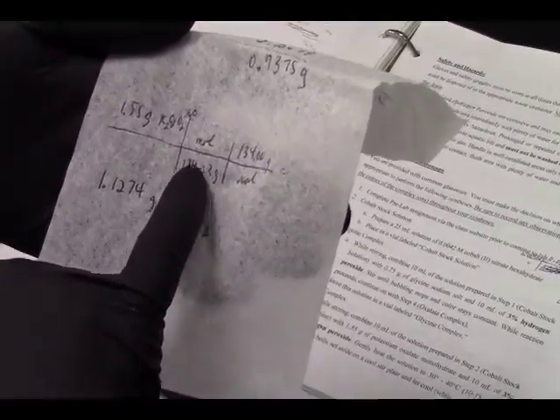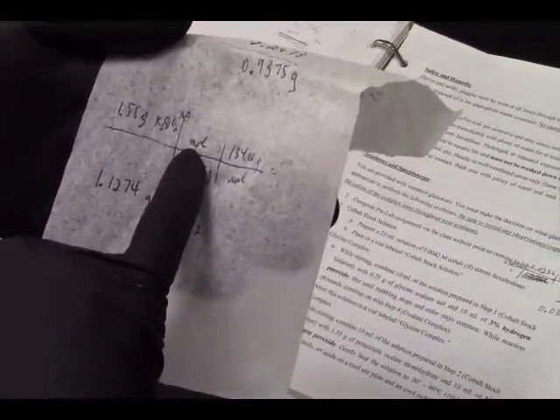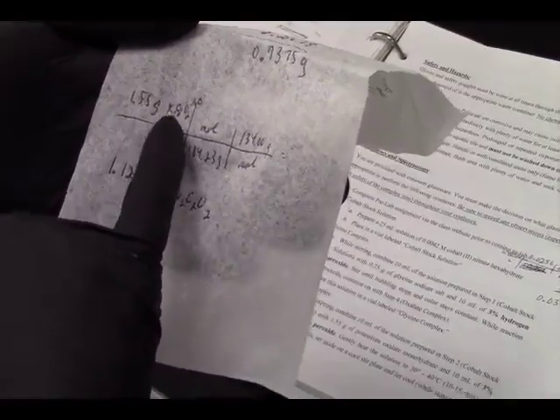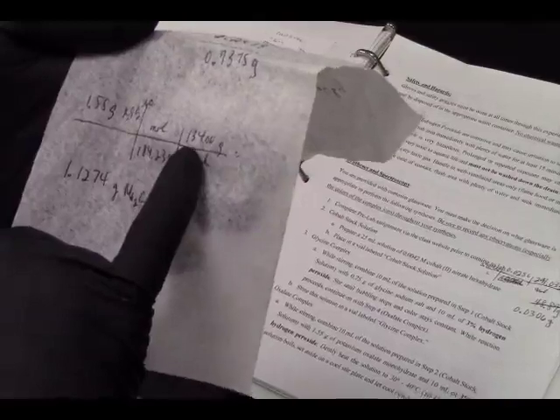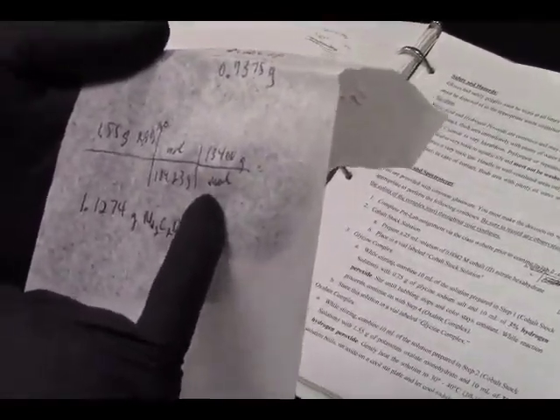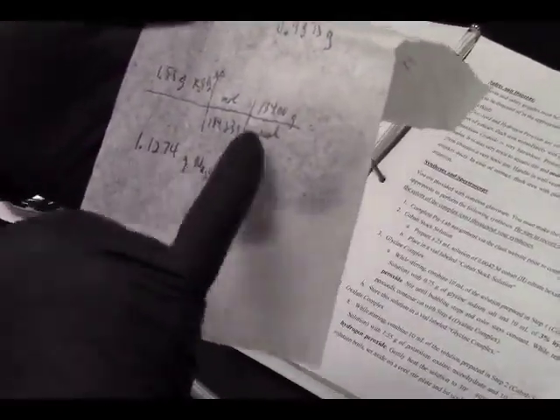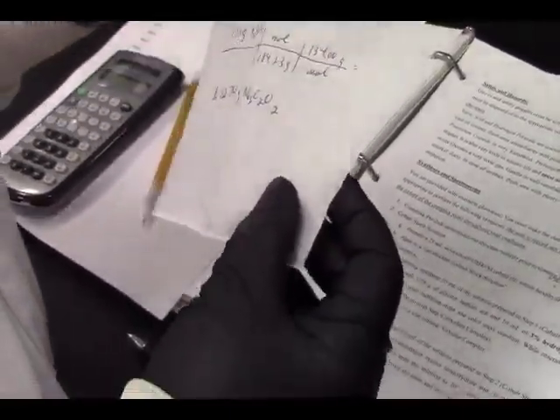So I'm going to take my gram amount and divide it by my molar mass to give me the moles that that's equivalent to. There's a 1-to-1 molar ratio of the potassium oxalate to the sodium oxalate, and my sodium oxalate has a mass of 134 grams per mole because it is not a hydrate. With this math I figured out that I need 1.1274 grams of sodium oxalate. So let's weigh that out and we'll be right back.